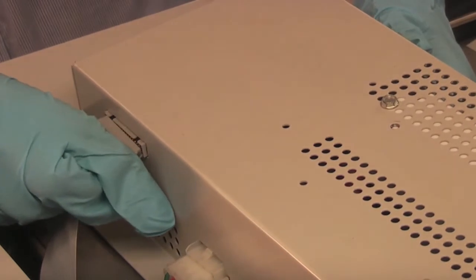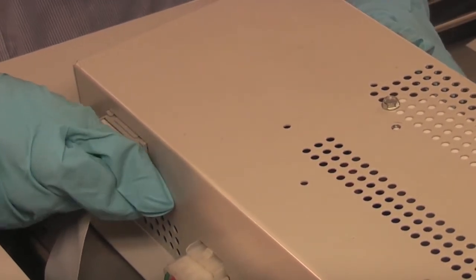Reattach the electronics module to the top of the cabinet before reconnecting the electrical power.